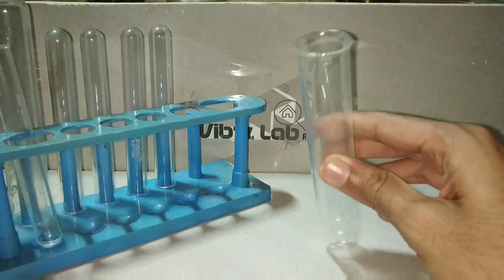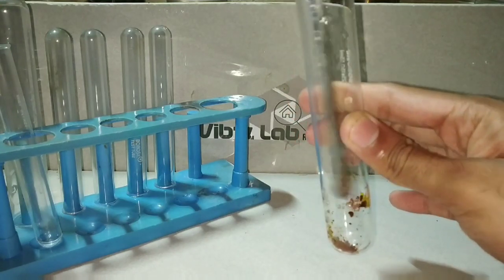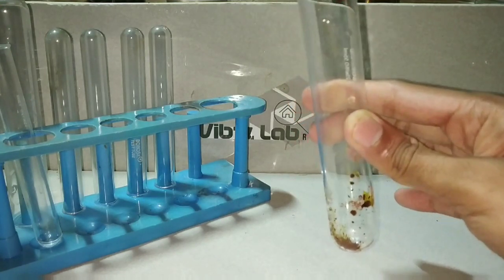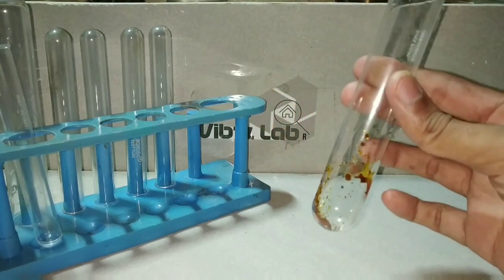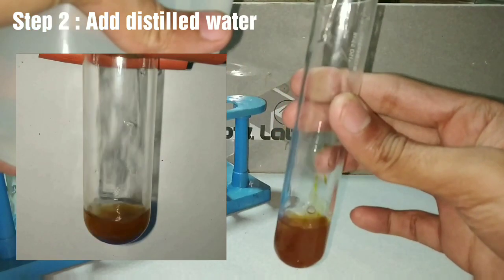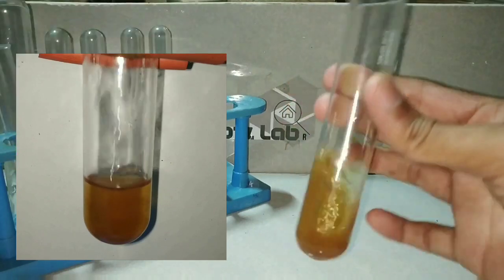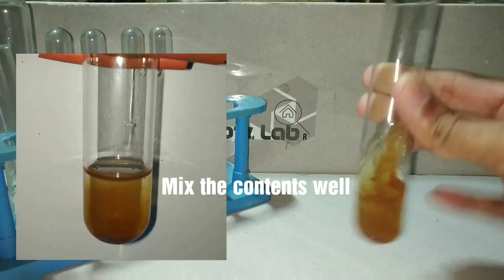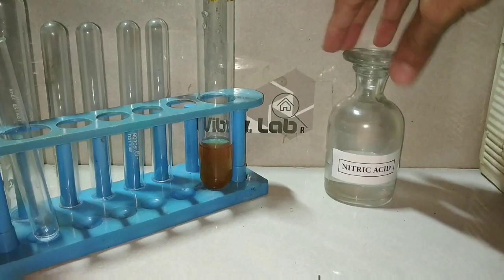The solid salt has overlying moisture because of water absorption. Now we are preparing the original solution. The original solution is prepared by dissolving the solid salt in distilled water. Here I have taken the solid salt and now I am adding distilled water into it. You can see that the salt dissolves immediately in water.